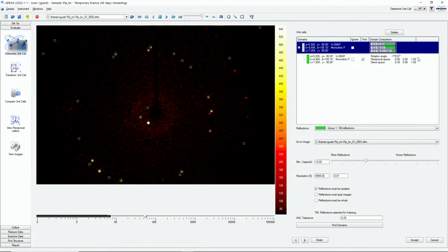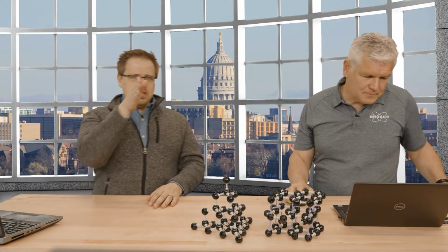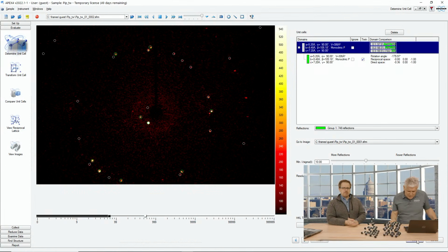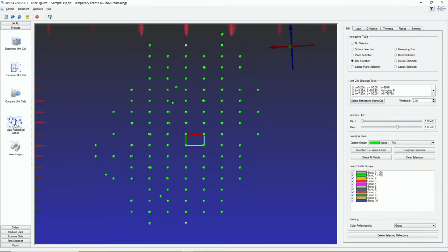Okay. So around this reciprocal vector, around reciprocal C star, that's where we have our 180-degree rotation. And I think we kind of saw that in the data, how it did line up along some direction. So when we go back here, I will accept that, just to double check. And the reciprocal space viewer is nice because you can do a sort of sanity check.